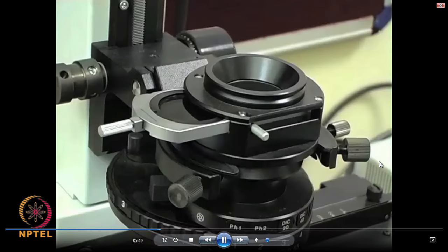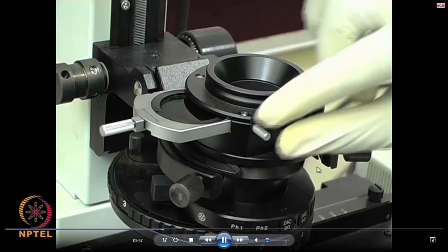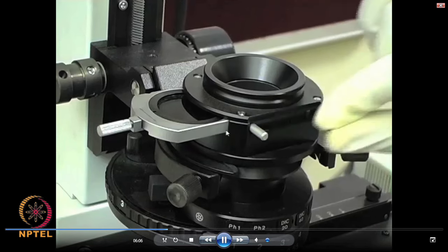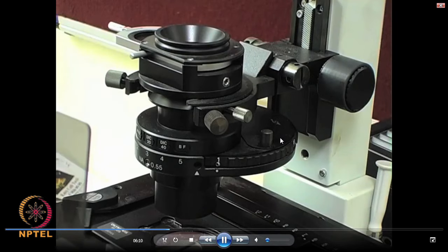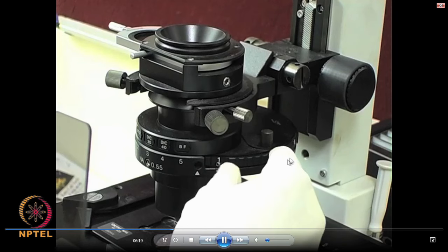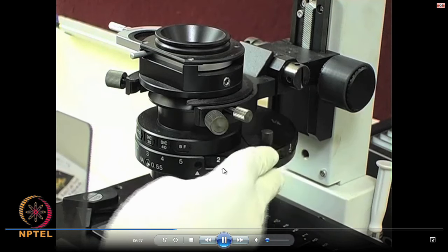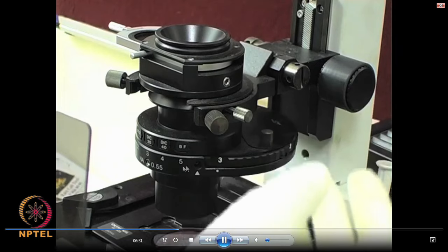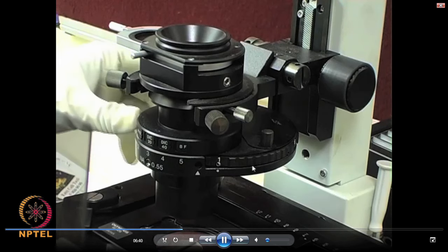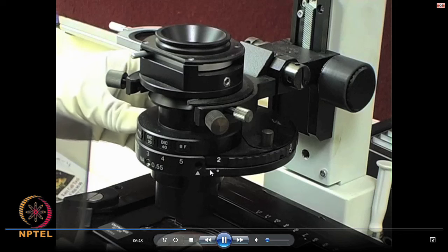The architecture is very different from the simple vertical microscope. What you are now seeing is a polarizer which is being engaged — in normal bright field illumination you disengage this, so that light can pass through. Below that is a set of condensers, filters, and apertures belonging to different modes of operation. You can see they are numbered 1, 2, 3, 4, 5 and so on. Depending upon the operation mode, you turn this condenser and aperture to a particular slot indicated by a white dot, so that you will be able to perform that particular operation.